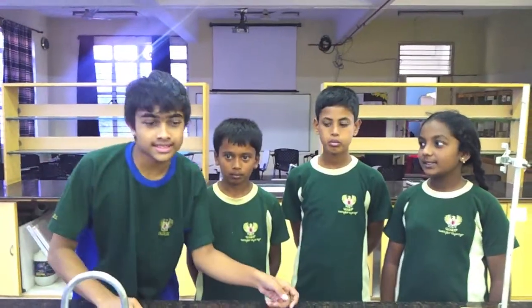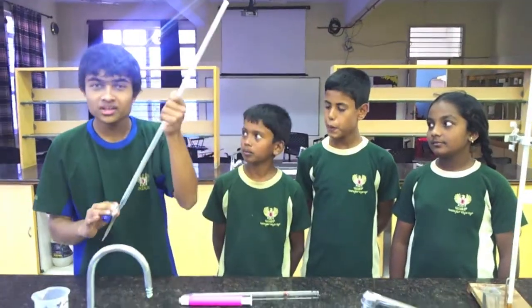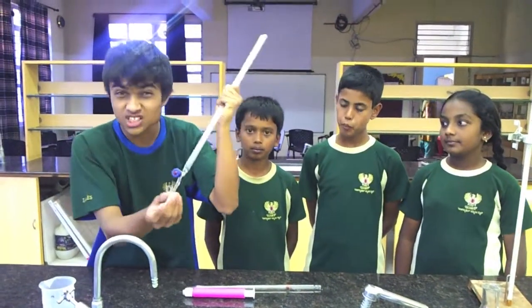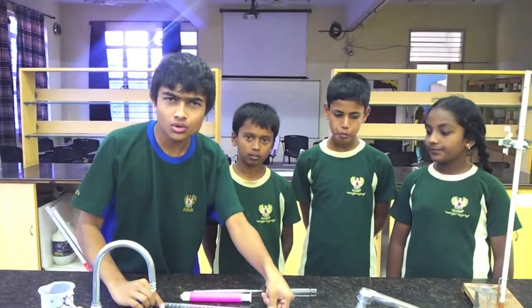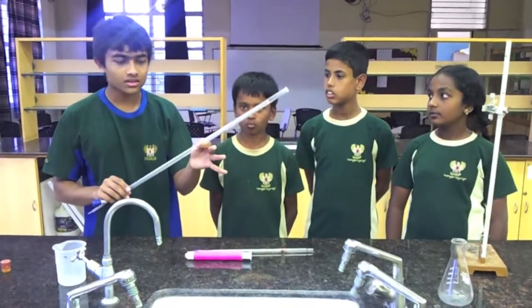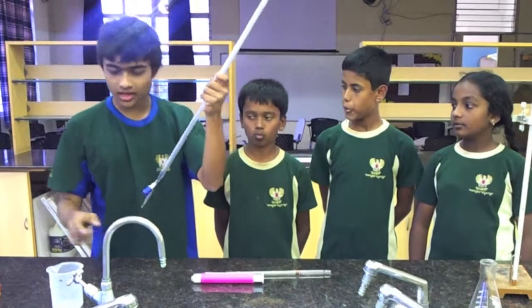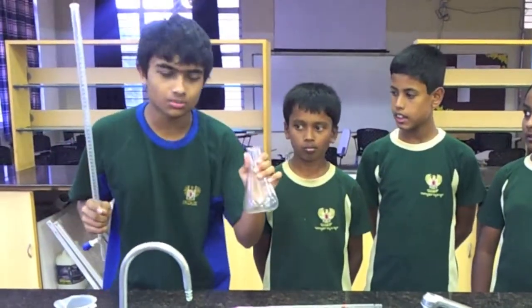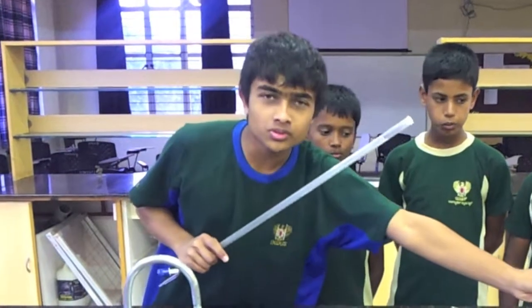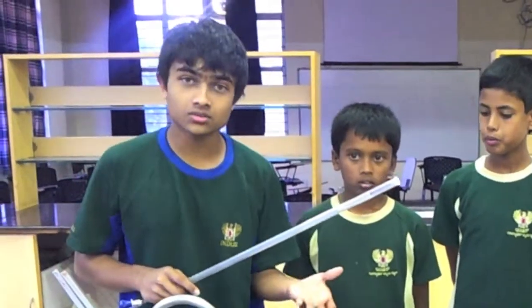My hypothesis is: if you have a vacuum pump that will actually have a suction as small as this little hole over here, can you pull the liquid from this buret and pull the liquid down to a flask just like this — except this flask would be a vacuum flask? Is that possible if you fill the vacuum pump with air? Let's find out.